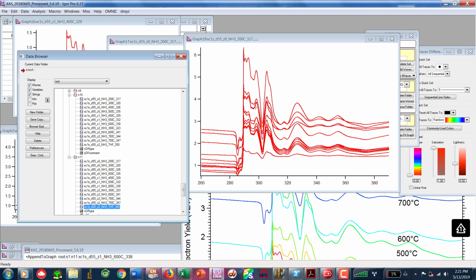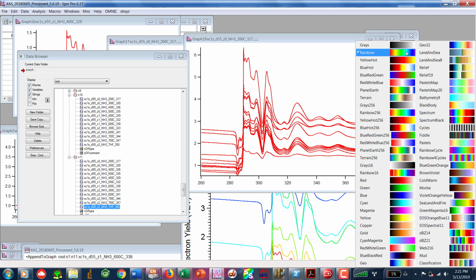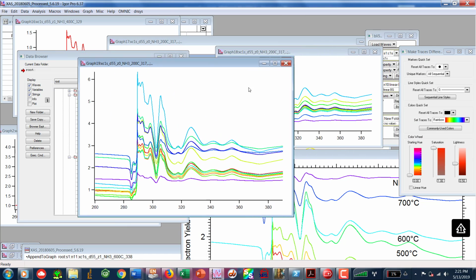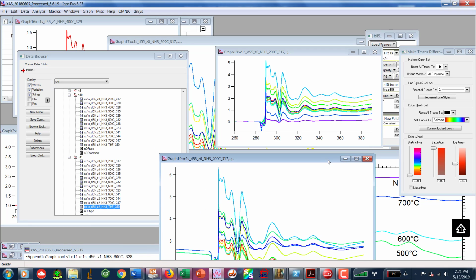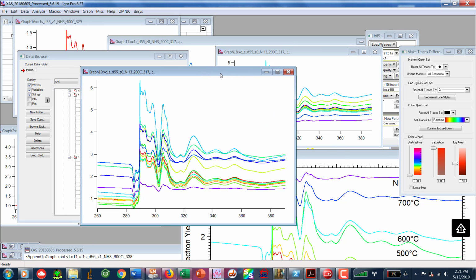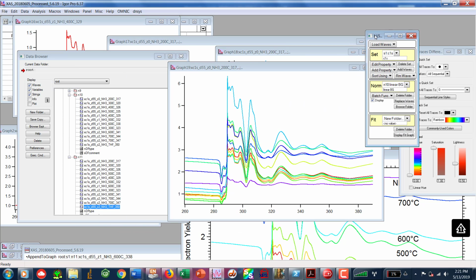Okay, so you notice all of this is all over the place. I'm going to give it some color just so you can differentiate between everything. And here we are, we're looking at our data. Hopefully we should end up with something similar to what we have right there after we're done. So this is what I'm doing. I'm going back over into our batch folder, and I am going to select LinearBG 2, which was our duplicate that I created just so I could do some of the work.